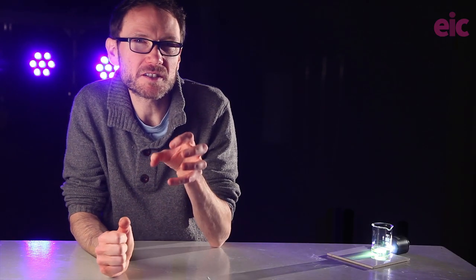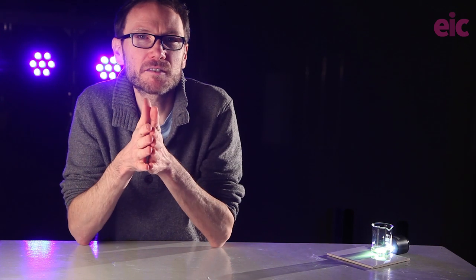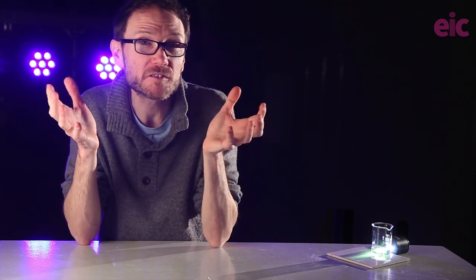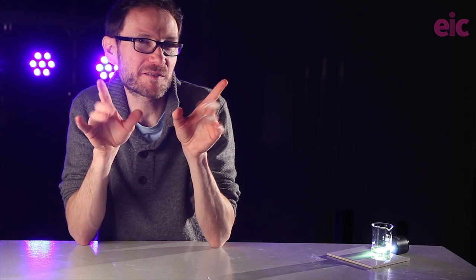So I thought that the best good that I could do for you would be to see if I could try out some different methods, get a sense for how long they take, and find out if it would be possible to accelerate this reduction so that you could reasonably run it as a demonstration. What follows is the result of literally a tear-inducing number of hours in the lab, but I'm really grateful for the support of all of the community out there on social media who've provided some fantastic ideas and helped me to move this forwards.